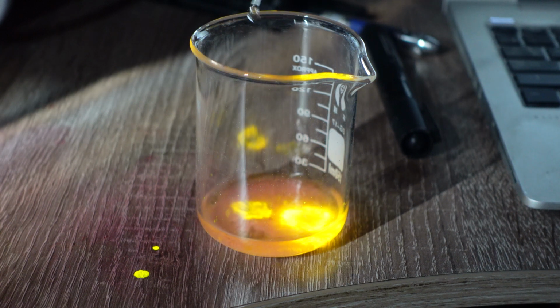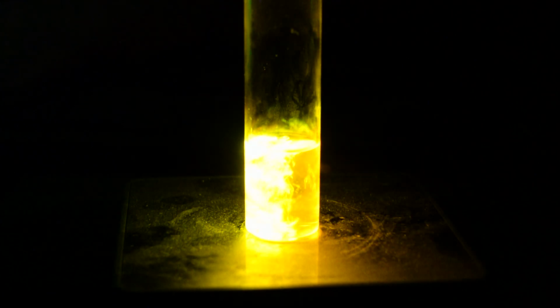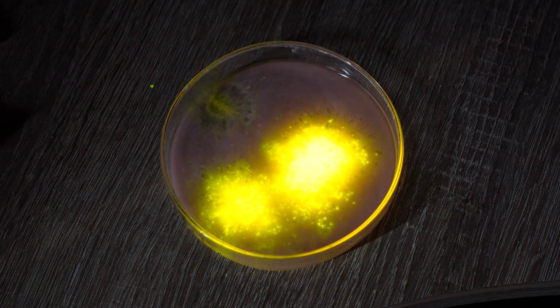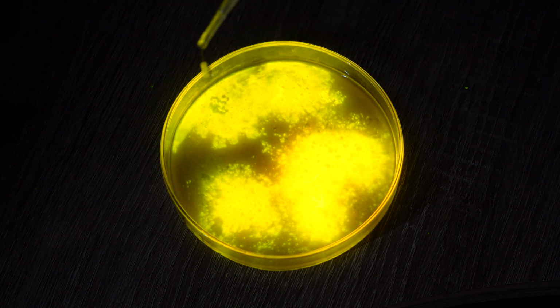Hey everyone, this is a somewhat belated video on the synthesis of dinitrophenyl oxalate, the main component for demonstrating the glow stick reaction. The synthesis isn't complicated, but only if you're in a lab. For this synthesis, you need dinitrophenol itself, which I synthesized in one of my previous videos.